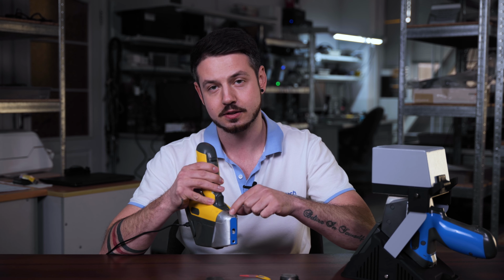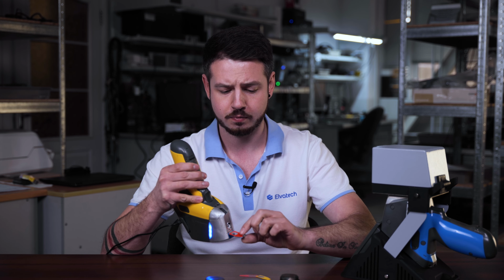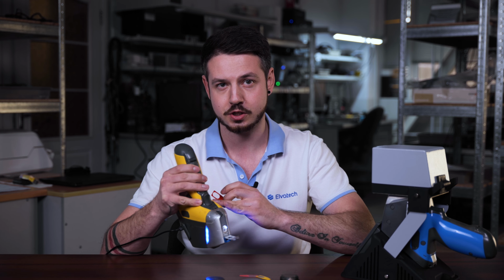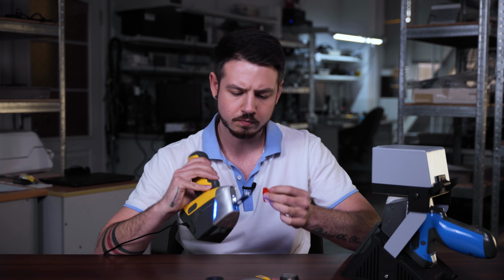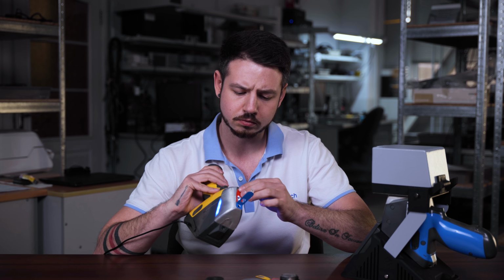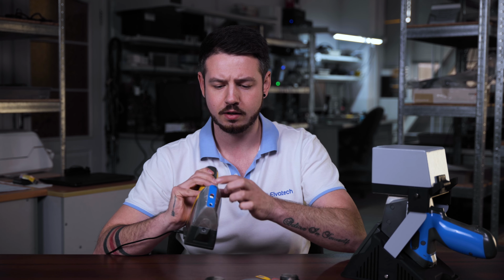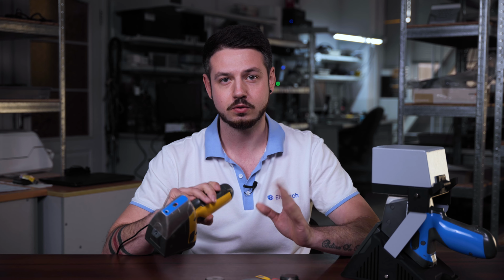If your analysis includes light elements like aluminum or magnesium, you should use a different cartridge that minimizes particle absorption and ensures accurate measurements. To change the cartridges, we need just to press this button at the bottom, and we're using the red ones because this one has the light elements option included. So all we need to do is just hold it in the right way and then close. That's it, it's ready to use.